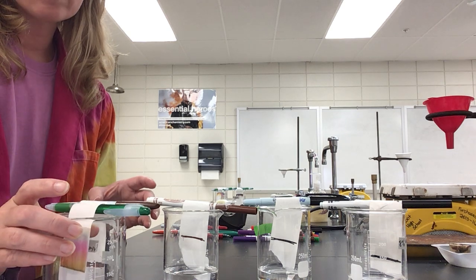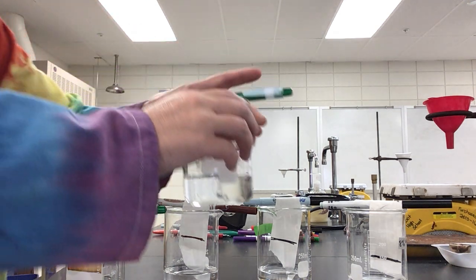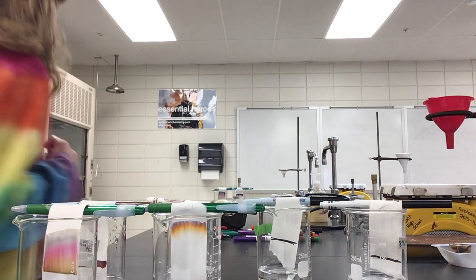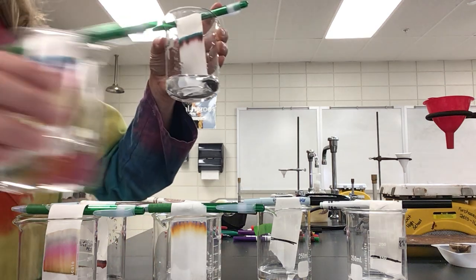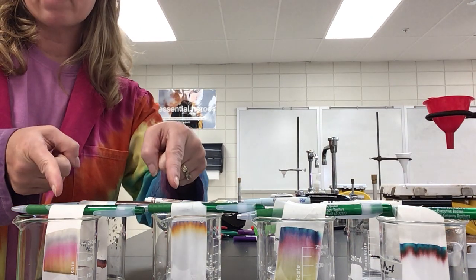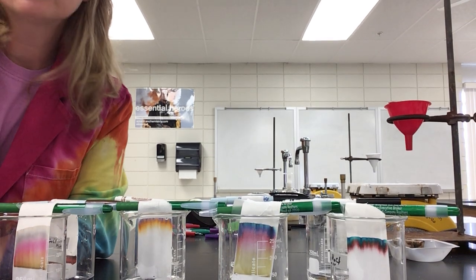Now, here's the cool part. That's the same marker, okay, with it separated. And what is crazy about this is these two are the same color. Fascinating, isn't it? They both made brown, but they look incredibly different from each other because they're made by two totally different companies. So those are my two browns, and these are my two black colors, okay? And like I said, as you can see, all right, complete difference.